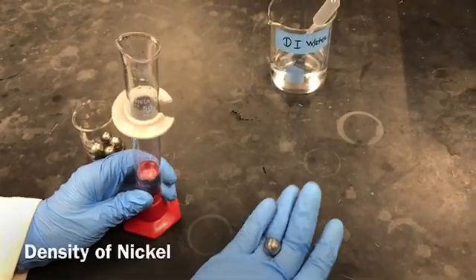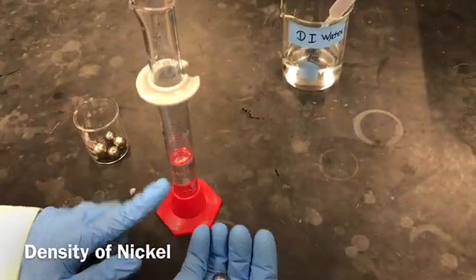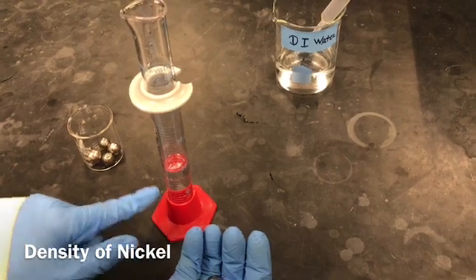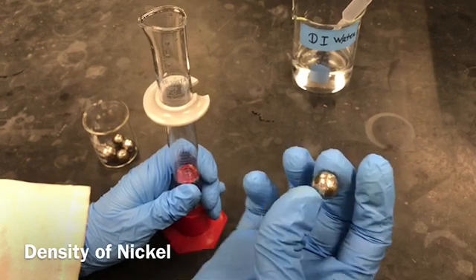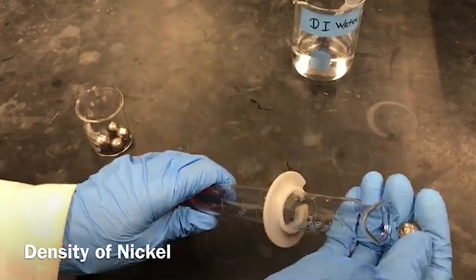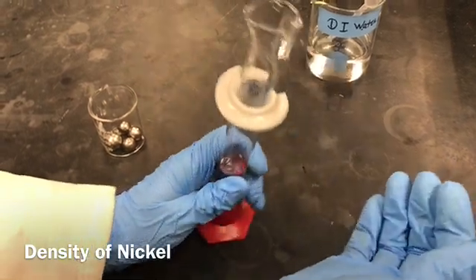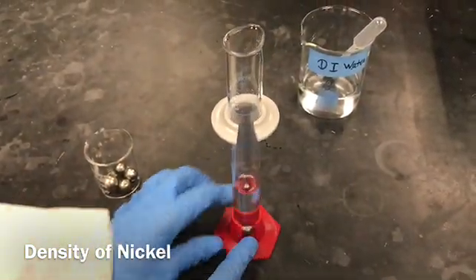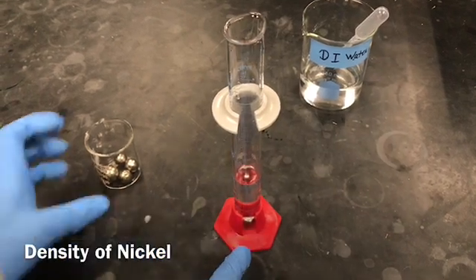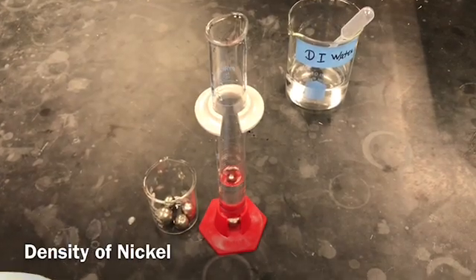Okay, now I'm going to add those weighed nickel spheres into the graduated cylinder, which has about 20 milliliters of water in it. Make sure you add these spheres very slowly. You're going to roll them down. Do not add from the top, it might break the bottom of the cylinder. And likewise, I'm going to add all the other spheres into the measuring cylinder.